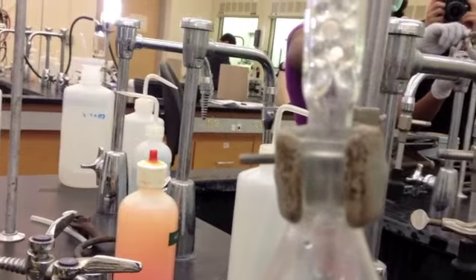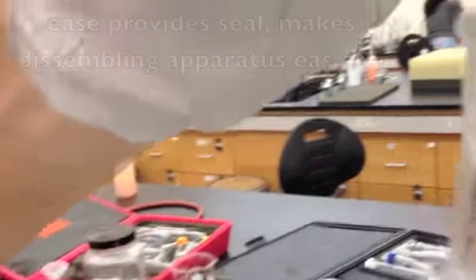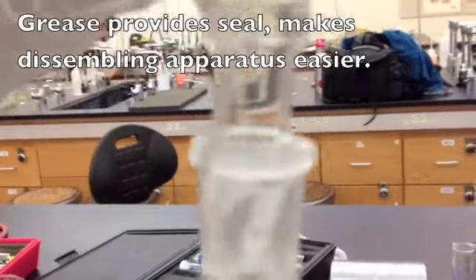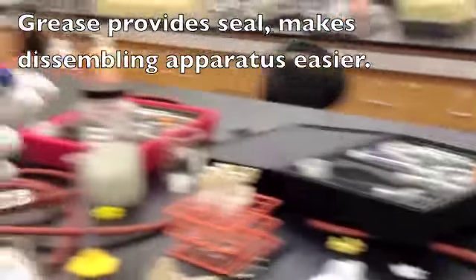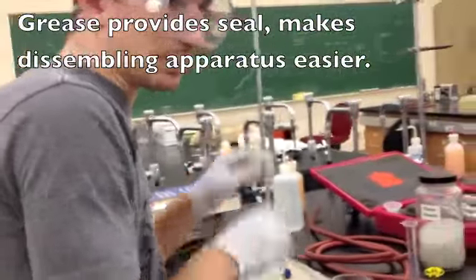Once you have your glass beads, use a two-finger clamp to secure it tightly. Otherwise, your glassware won't seal properly. Once you clamp it, the white parts are what you will get if you do not grease it. Ensure you have an even seal. Now, you want to make sure your column is as straight as possible.